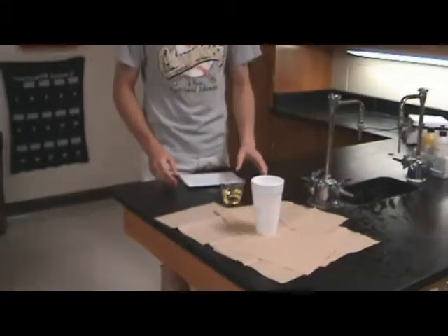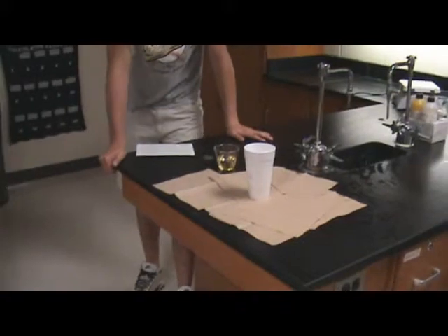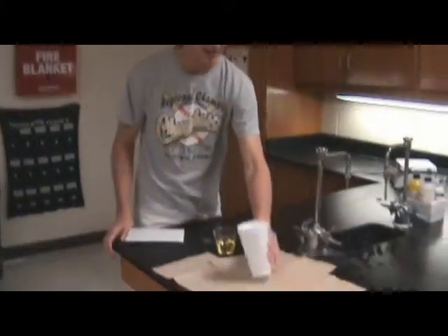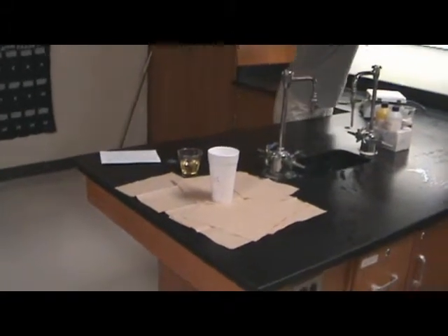We've got two parts, Part A and Part B. Part A is a viscous cream-colored liquid that contains a polyether polyol, a silicone surfactant, and a catalyst. Part B is very syrupy and dark brown. We're going to add these together and mix them, and they will expand to 30 times their size.